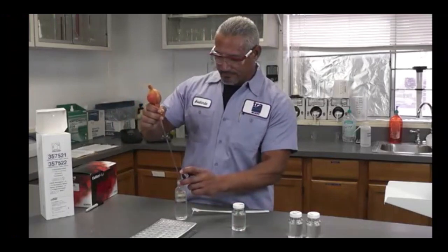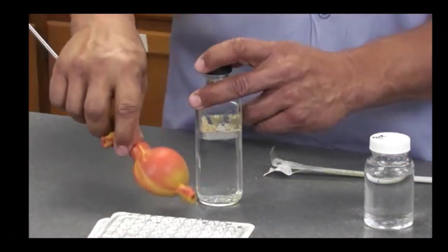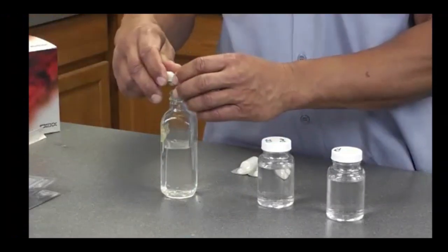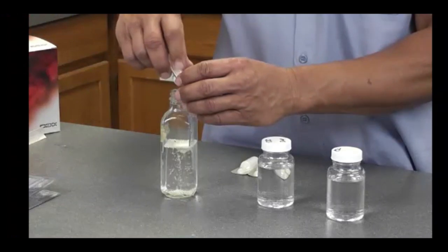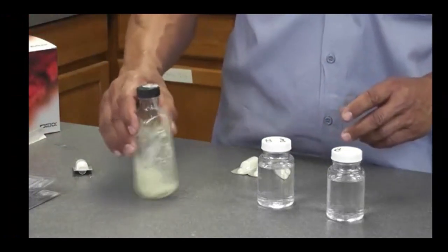Do not put the cap of the sample bottle, the dilution bottle, or the sterile pipette on the counter during the transfer process. Hold the caps pointing downward to prevent airborne contamination and recap as soon as transfer is complete. Add the contents of 1 packet of Colilert media to the sample bottle using aseptic technique. Reseal and shake the container lightly or swirl to mix.